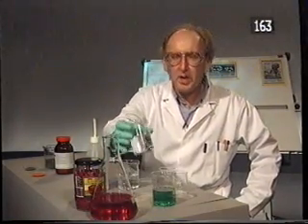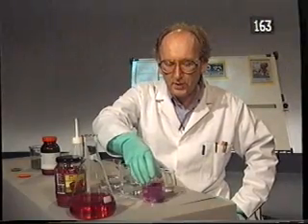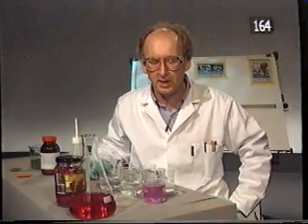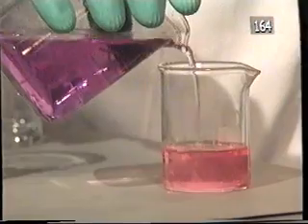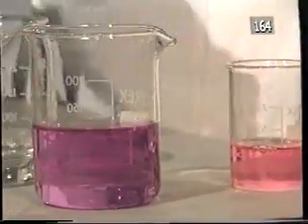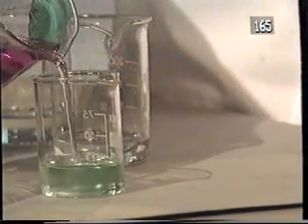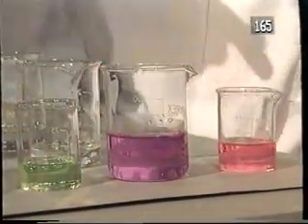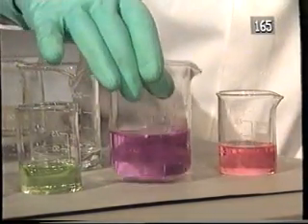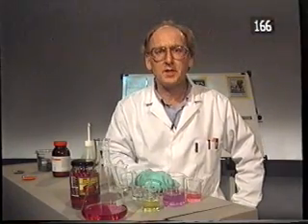If I add just the right amount of acid, I can get a purple colour. This purple solution contains roughly equal amounts of our red reactant and green product. And if I add this to acid, it goes over to our red compound, and if I add it to base, it'll give the green compound. So I've got the red reactant and the green product and a purple solution, which is a mixture of the red and green compound. Now let's look at another reversible reaction.